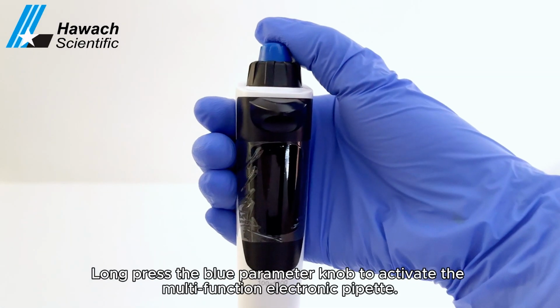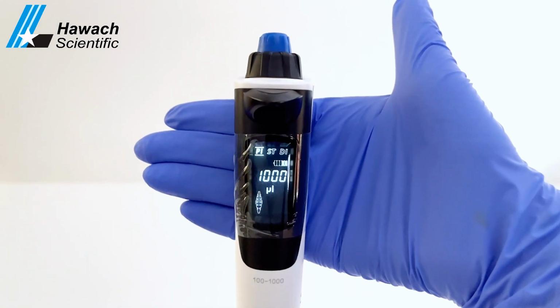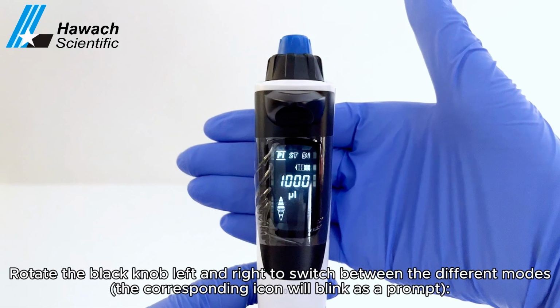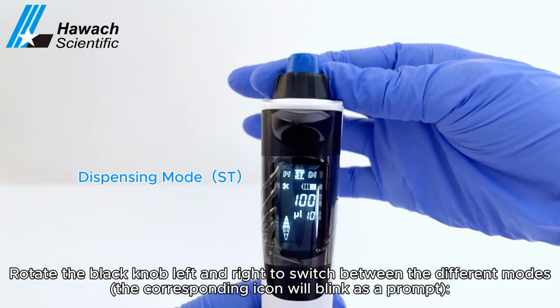Long press the blue parameter knob to activate the multifunction electronic pipette. Rotate the black knob left and right to switch between the different modes.